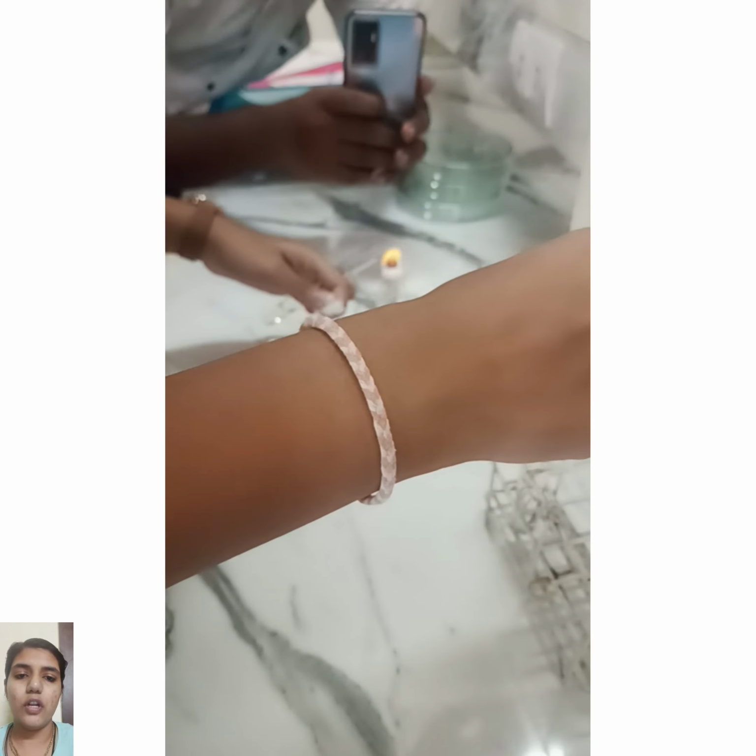Then we need to take up the test tube containing nutrient broth of one type, remove the cap and flame the mouth of it, and also avoid putting the cap of the test tube on the table and hold it in the same hand as the inoculating loop to avoid unwanted bacteria.